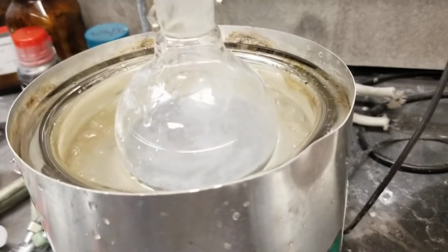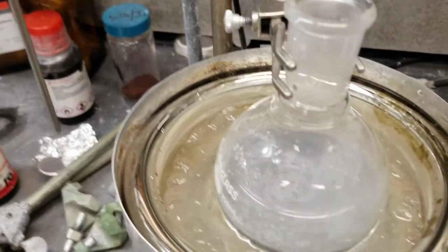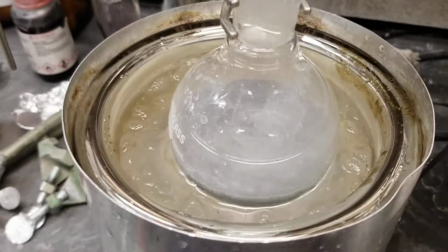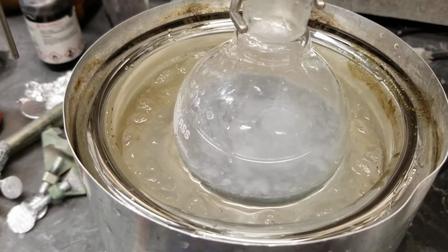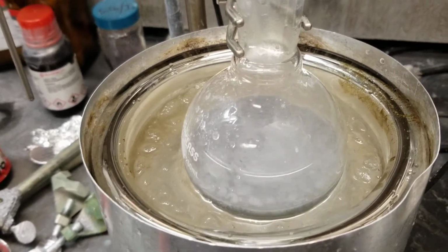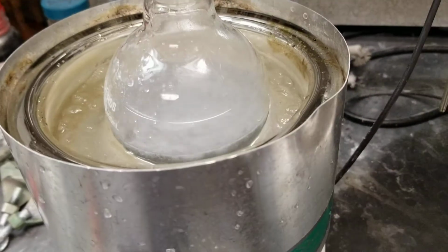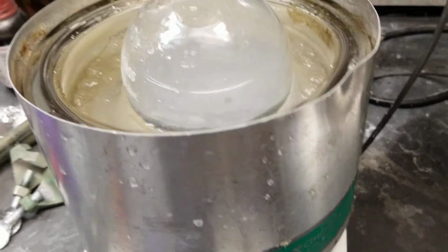So now I'm dumping in some acid into this reaction, and we can see the appearance of bubbles in the reaction solution. When this type of thing occurs, if you do not keep these at a lower temperature and you don't control the rate that you quench this material, you can end up with explosions of gas shooting out of the reaction vessel.